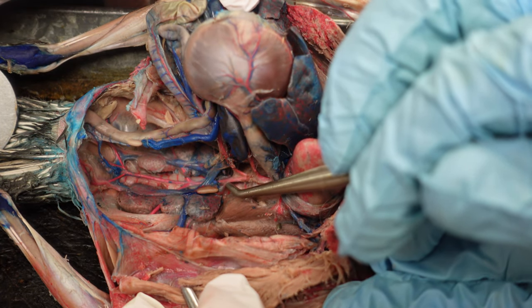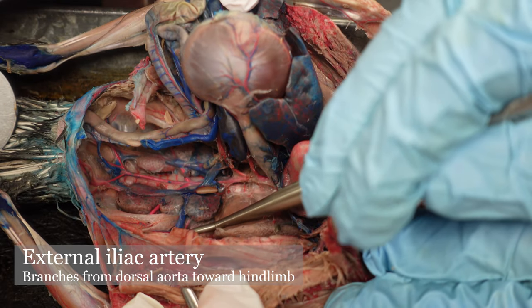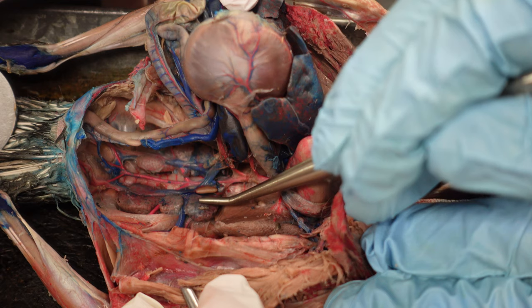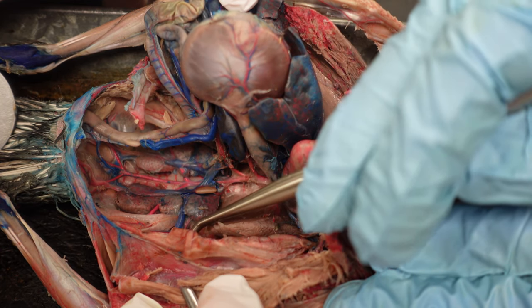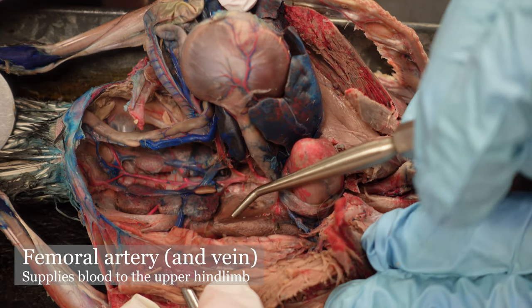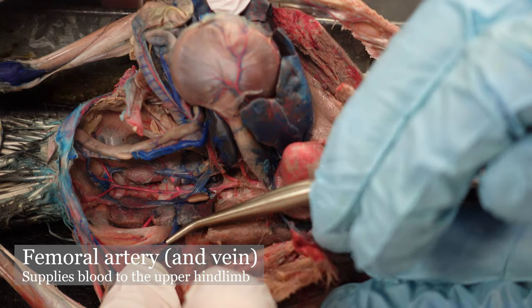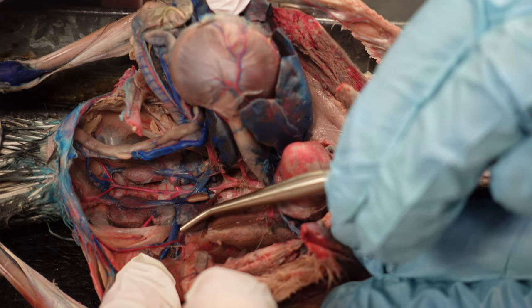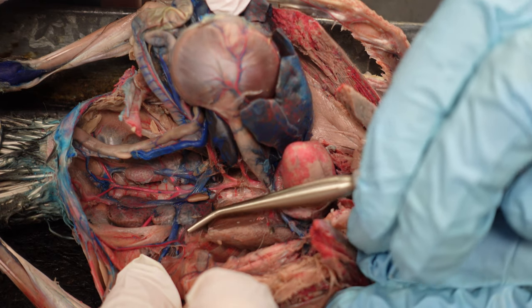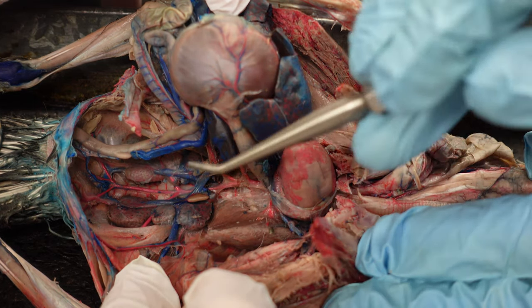The dorsal aorta splits into external iliac arteries that go toward the leg. You can see that external iliac artery right here going underneath this kidney, and it goes out to the leg where, once it passes through the abdominal wall, it becomes the femoral artery. It also sends off a little offshoot called the pubic artery — that's not on your exam, but it is something you might see, so we do want you to be aware of it.